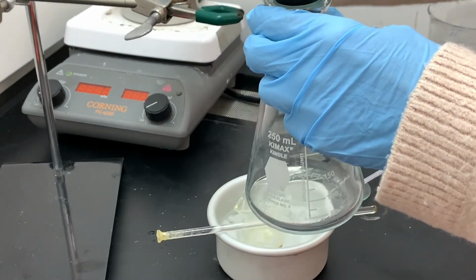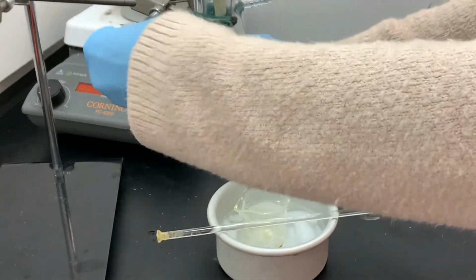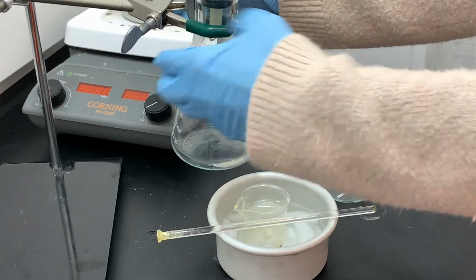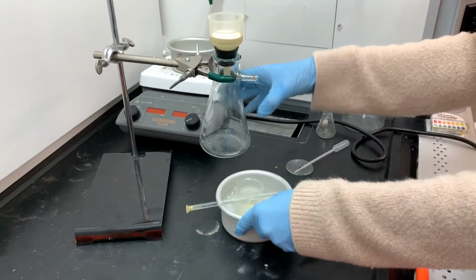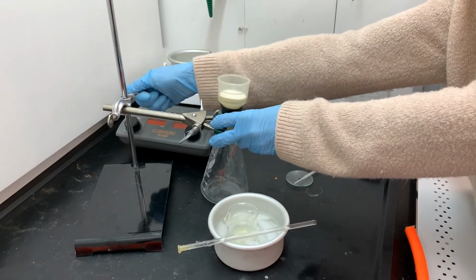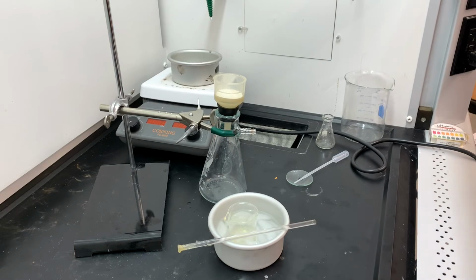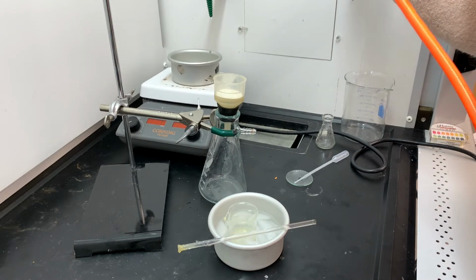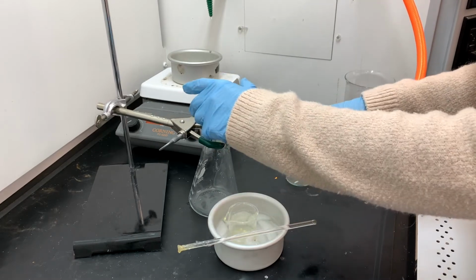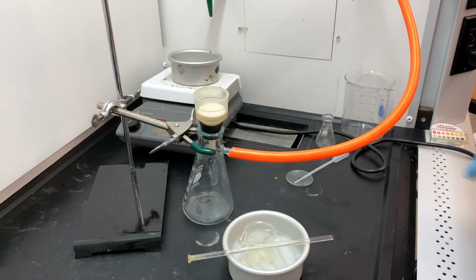So even though I'm setting up for vacuum filtration, I really don't expect to collect much product during the vacuum filtration process. I am okay with leaving my crude product stuck to the glass stirring rod and also stuck to the inside of that little tiny beaker. I can just recrystallize straight from that exact same beaker. In the recrystallization process, I'll be able to dissolve the product that's stuck to the inside of the beaker, and I'll also be able to dissolve the product that's stuck to that glass stirring rod.